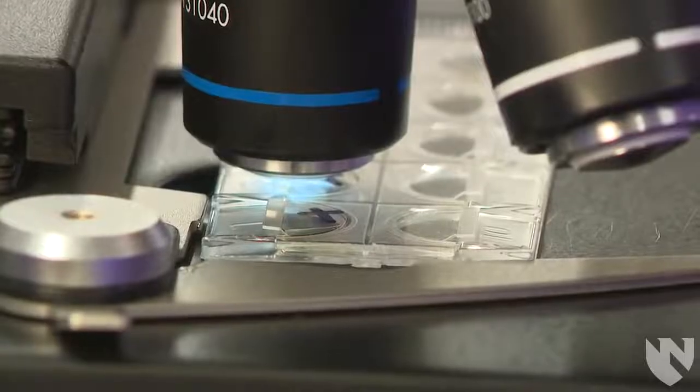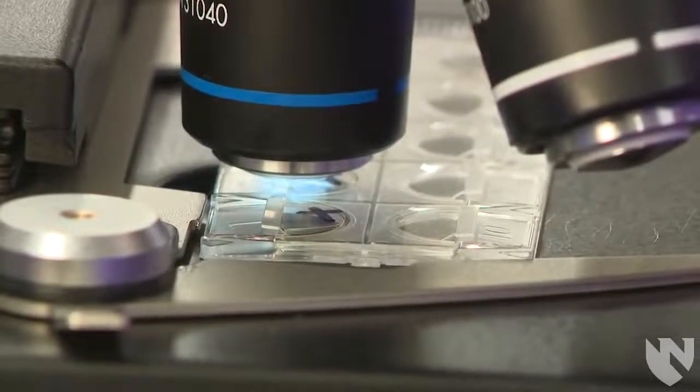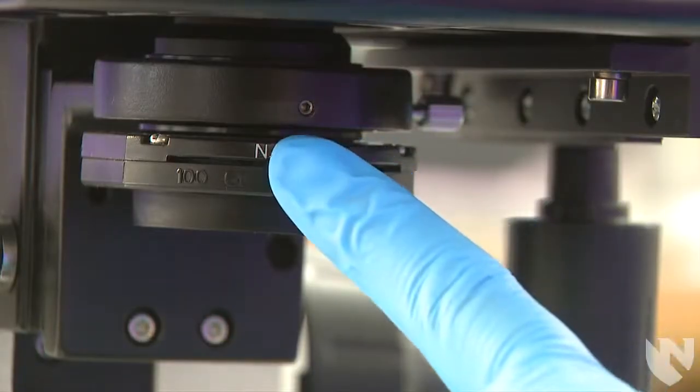Now we will move on to the high power objective 40x. You should have medium light intensity and your aperture should be one-half to two-thirds open.